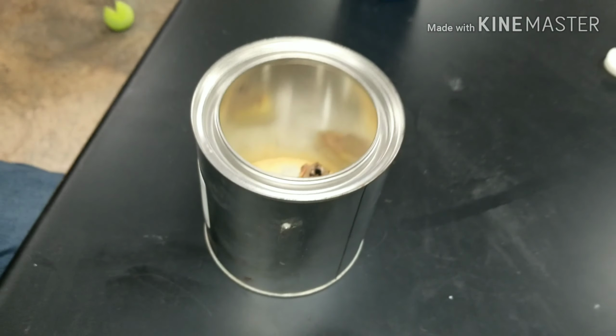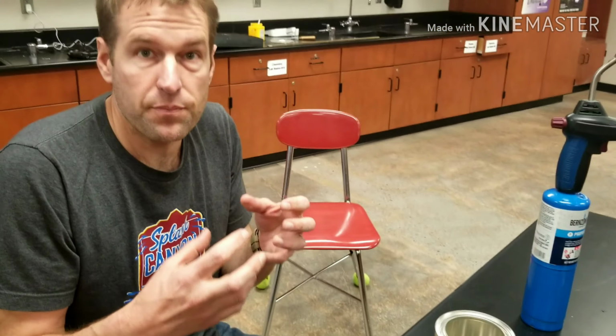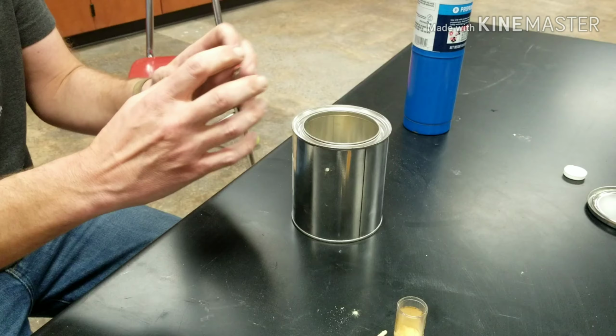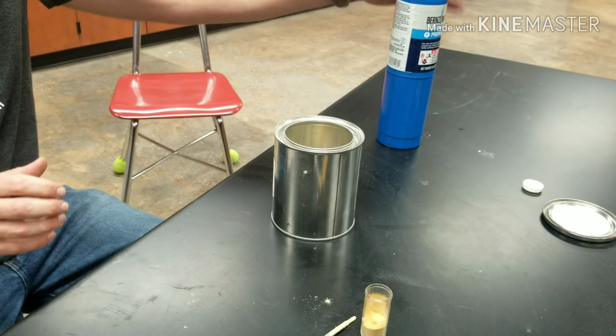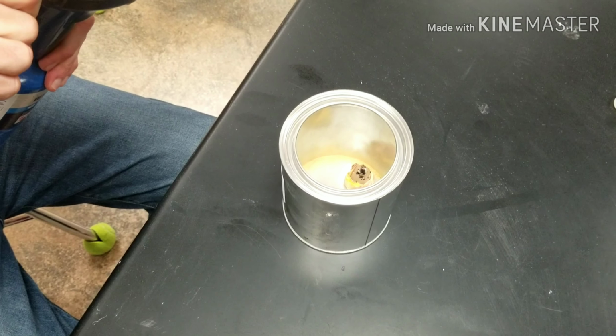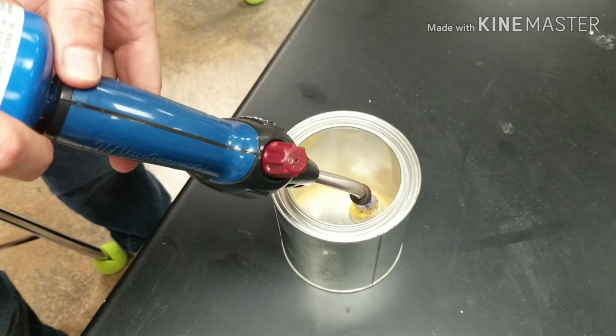So this is going to be a combustion reaction. But imagine the tiny amount of grain dust, about the size of a pea. But when I blow it into the paint can with the lid on, it's going to expand about the size of, well, the size of this container. So I'm going to light the candle with my torch of science here. It's easier than trying to reach a candle down in there. So I'm going to light the candle.